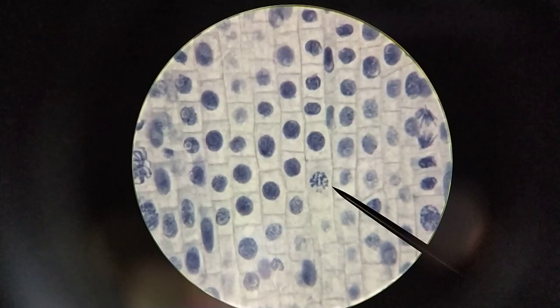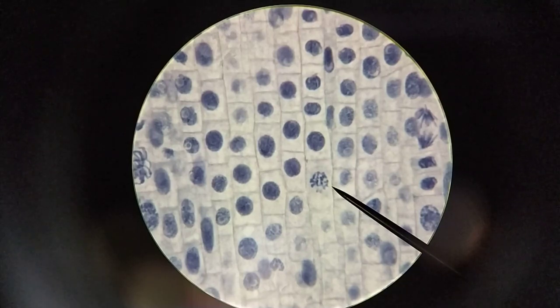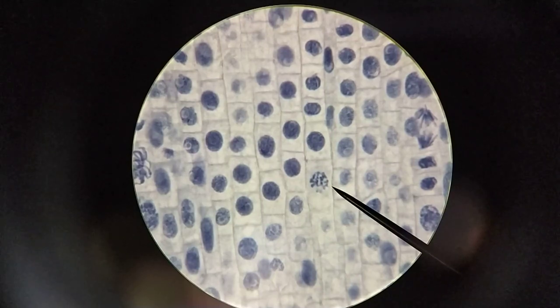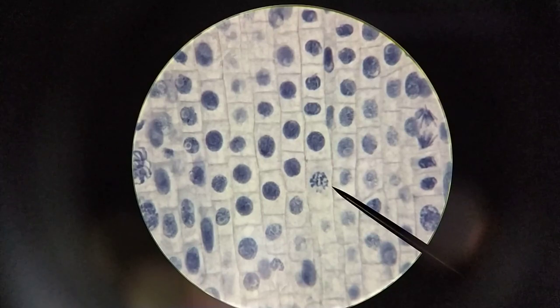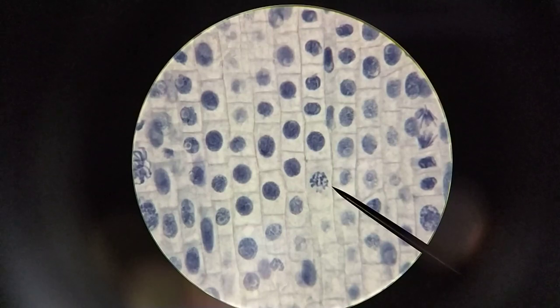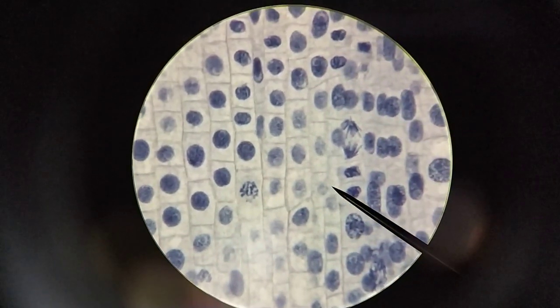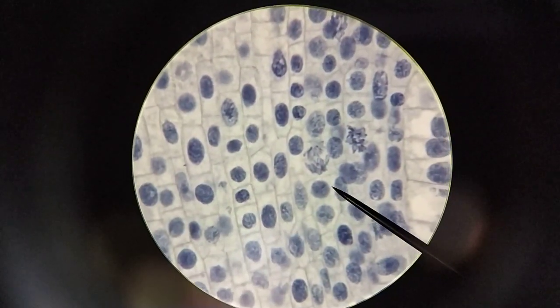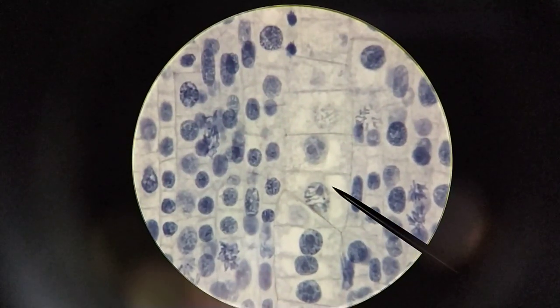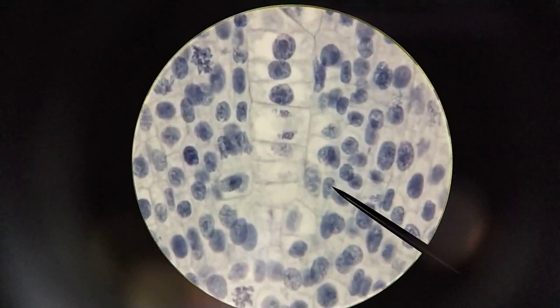With meiosis, if you're looking at a slide of meiotic cells, those cells will all be at the same stage - they'll either all be at prophase one, or metaphase one, or anaphase one. You won't see two different cells doing meiosis at completely different stages - that's very unlikely. I hope this has been useful and you've been able to see examples of what we wanted to show. I wish you could have seen this live in the laboratory, but I hope this has been helpful. Thank you.